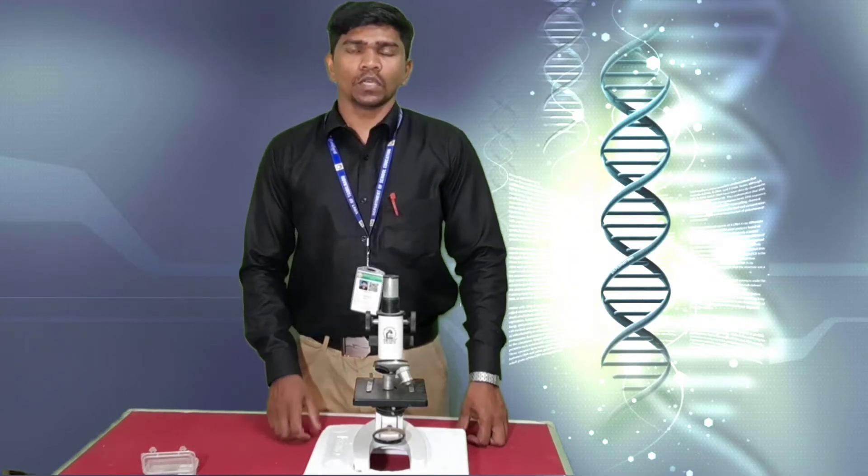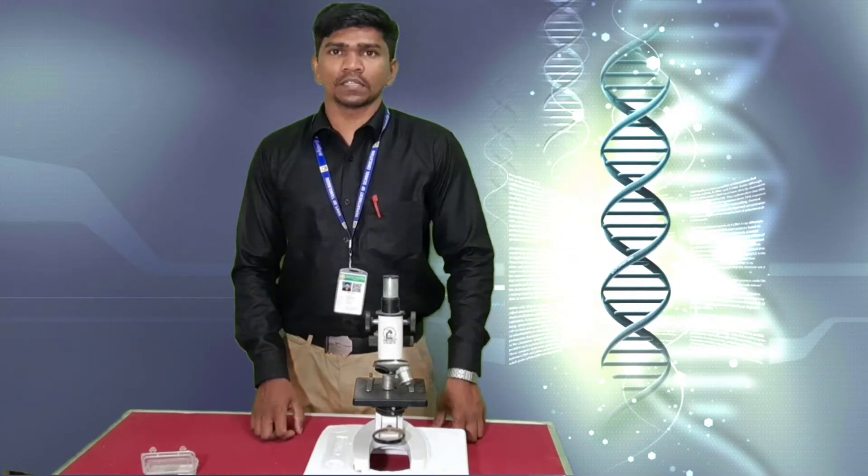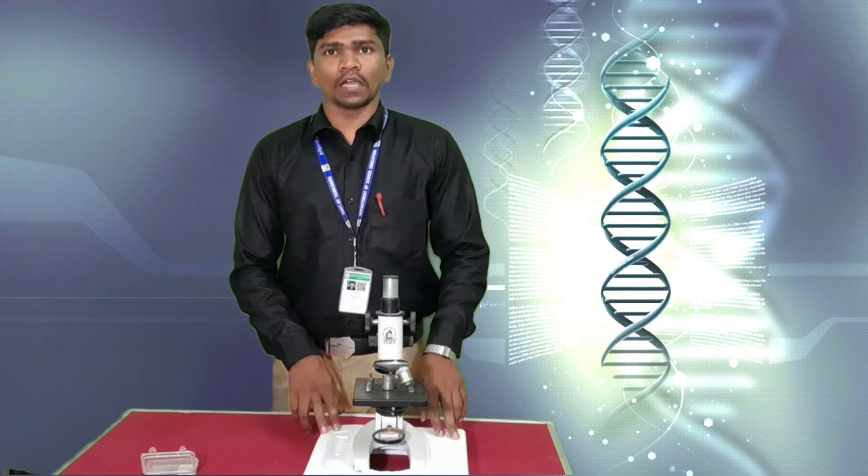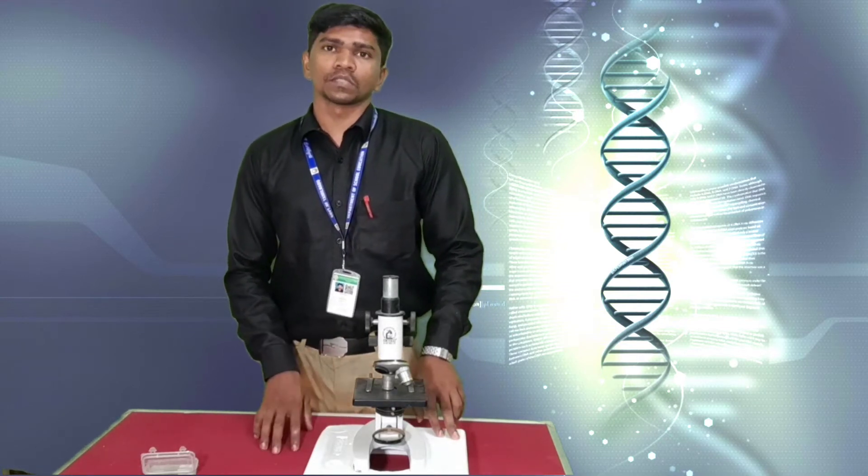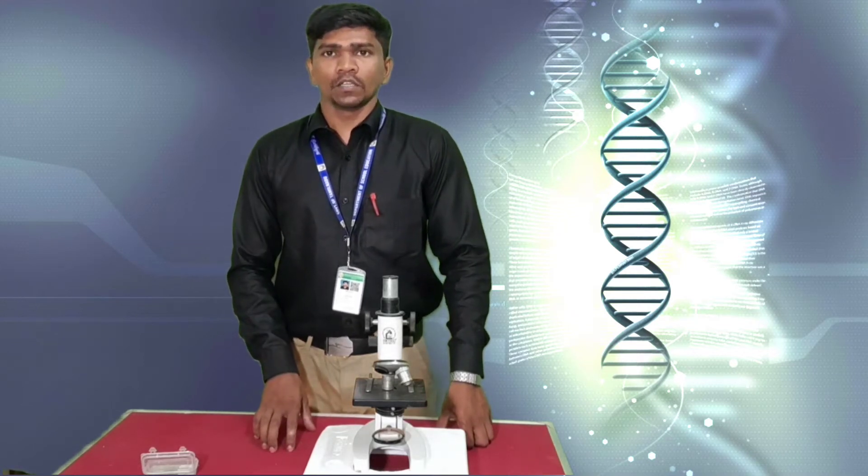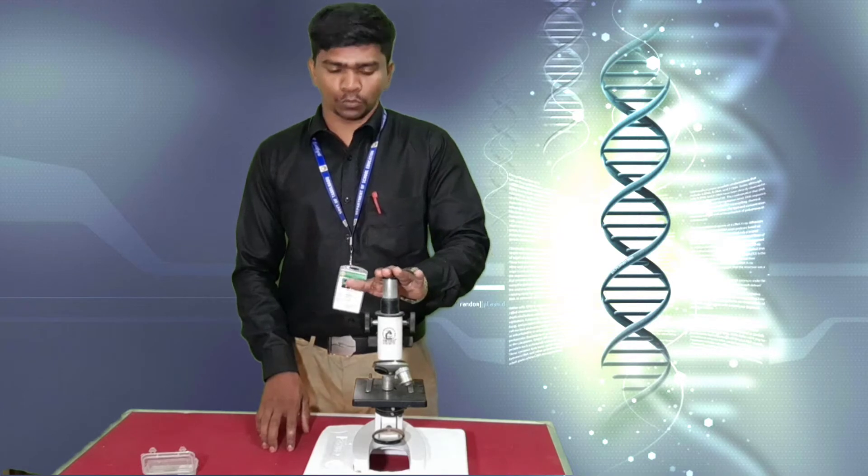Welcome students. Today's class we are going to see about 9th standard practical biology. In this class we are going to see about identification of microorganisms. As we know, we cannot see the microorganism with our naked eye.